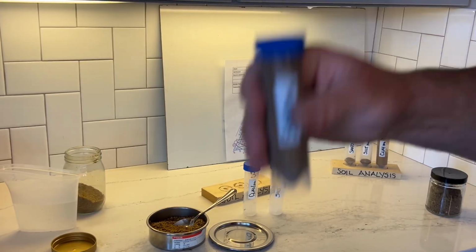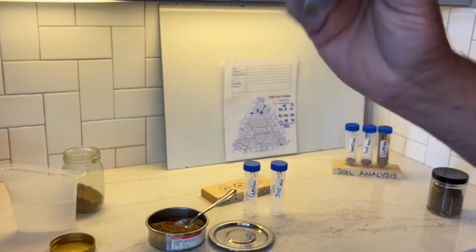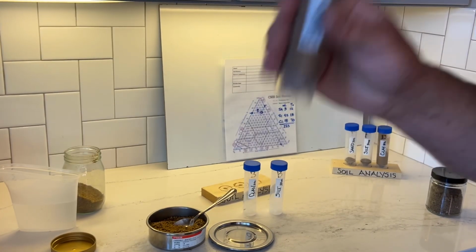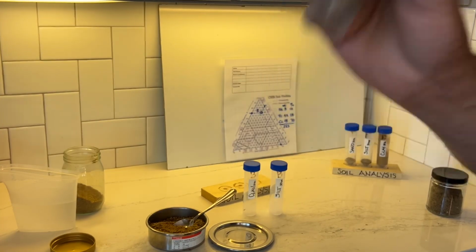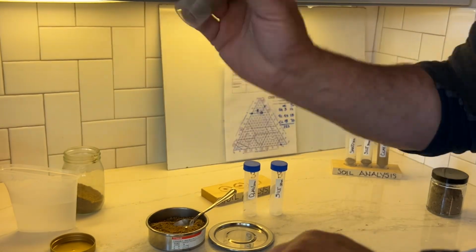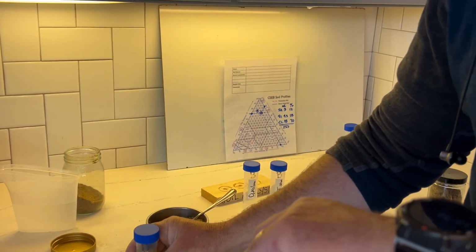You're going to want to keep your stopwatch or a timer on your phone handy, because basically we're going to separate these by time. Sand settles out, it's the heaviest, densest particles. It's going to drop out of the water column the fastest. We're going to give it 30 seconds. So, all right. I'm going to keep shaking until I have the top of the minute. All right. Now I'm going to stop and I'm going to watch for 30 seconds.